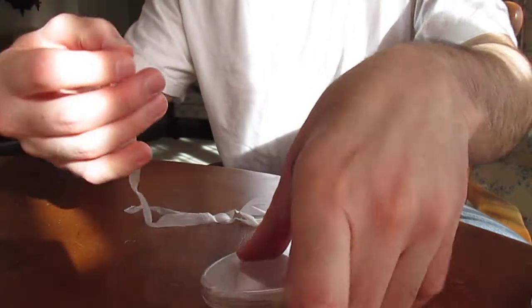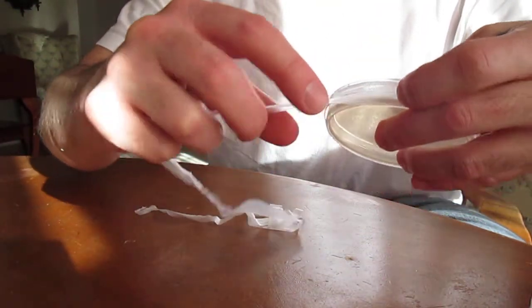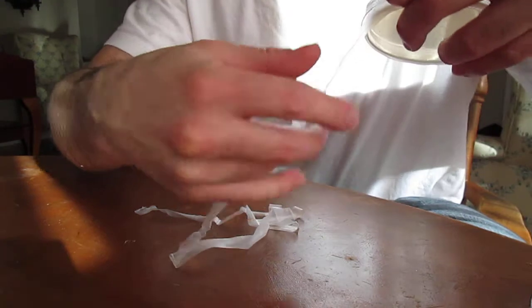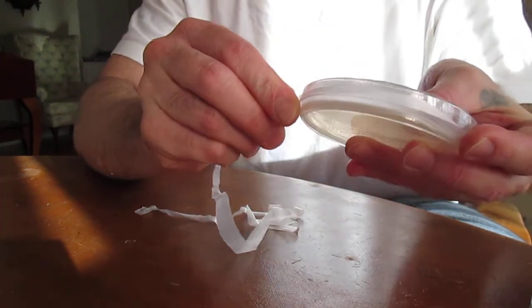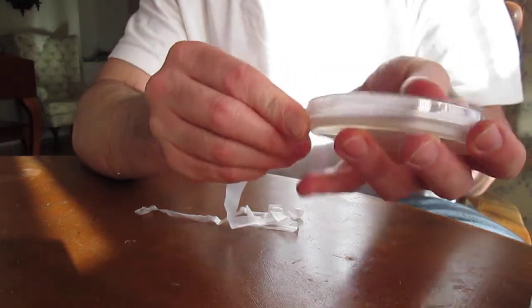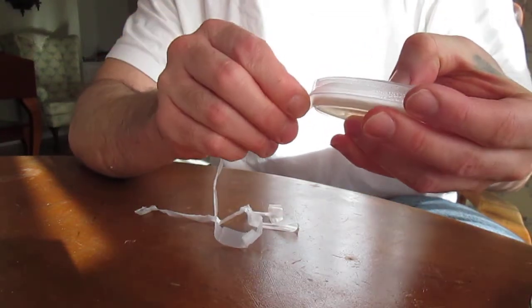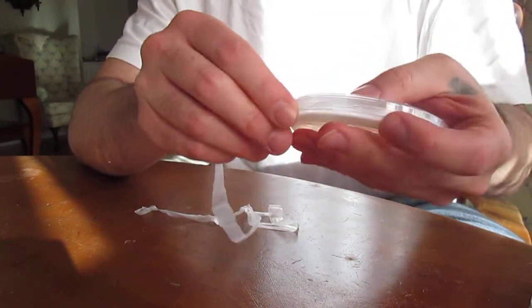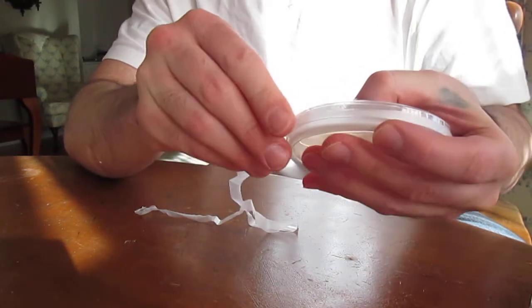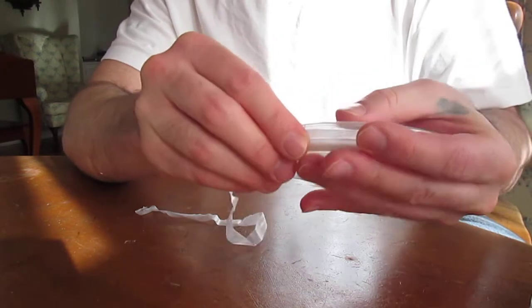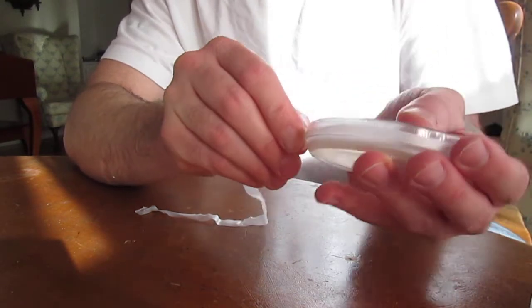After three days, if there's anything inside them—any kind of mold or bacteria—it'll start growing by then, and I'll know to throw out the bad ones and keep the ones with no growth. Most likely I don't think I'll have any contaminated dishes, but there's always a chance.